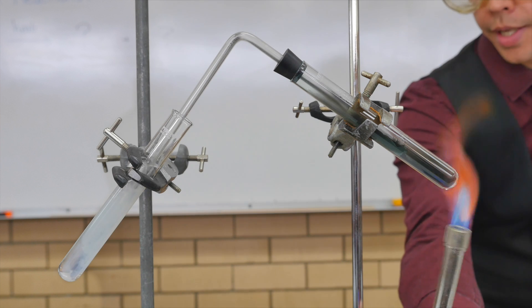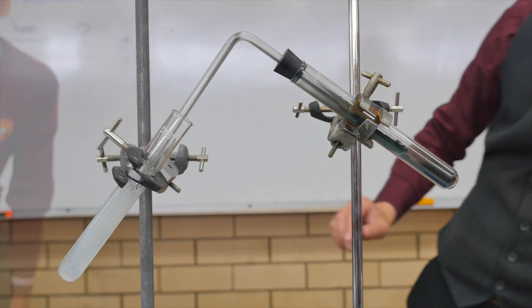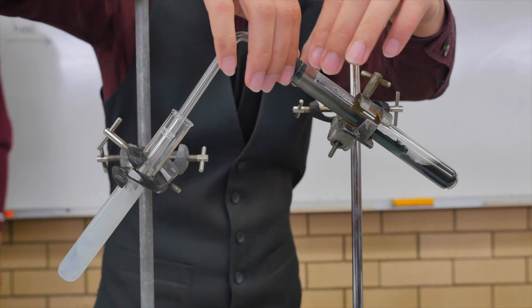So, what does the test tell us? What's it made out of? Carbon dioxide. Alright, so we're creating carbon dioxide gas. Yeah, before everything goes wrong, I have to unplug it.